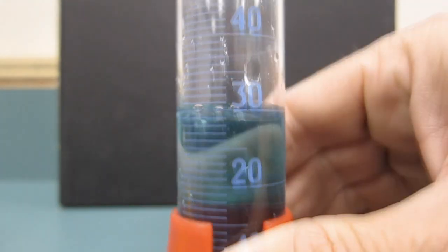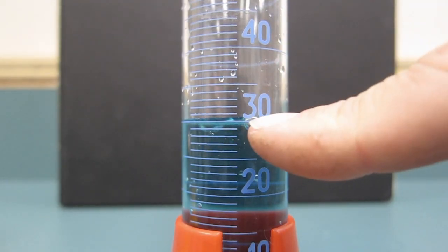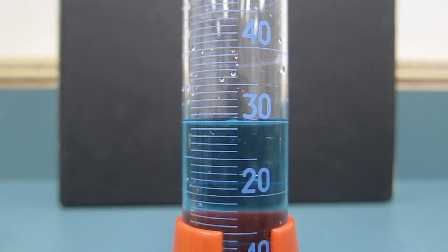I might be a tad short of that. Get the bubbles out of the way. You can see right here, that's the 30 line.